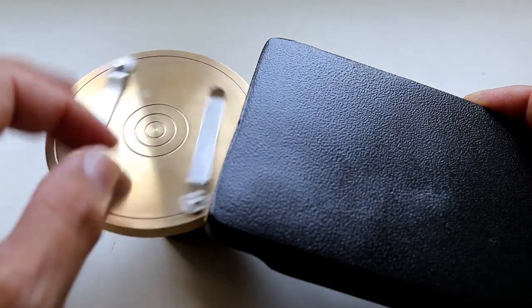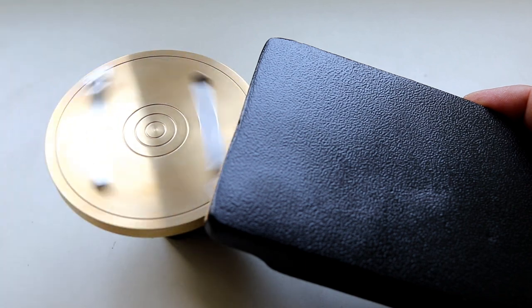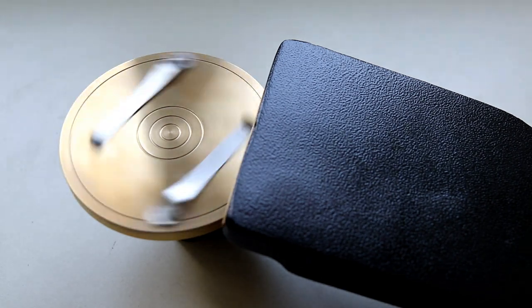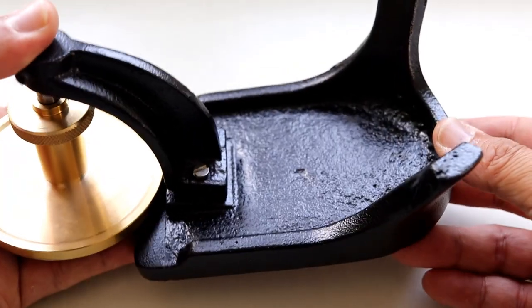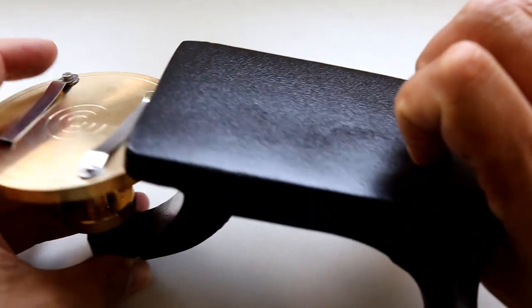Of course, there are also clips on here to hold the slide in place. It was actually spinning for several minutes, actually that efficient. It's the bottom side, and it's like this so that it's not possible for the rotating table to drop out.